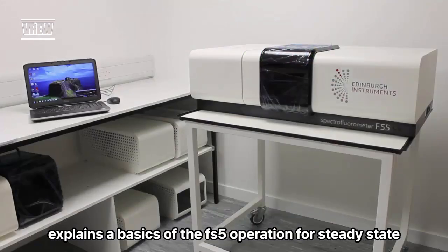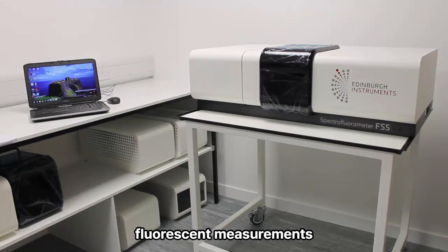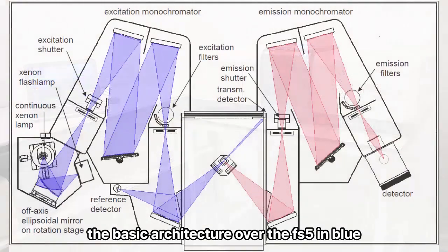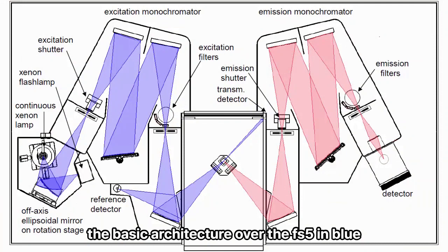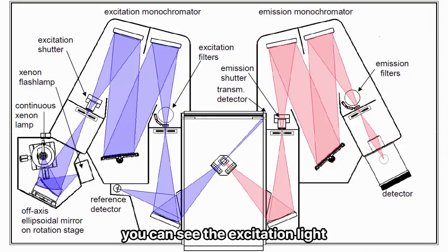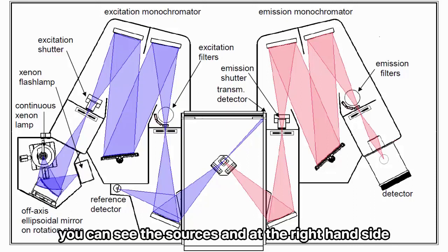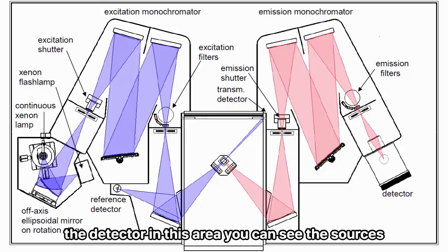This video tutorial explains the basics of the FS5 operation for steady-state fluorescent measurements. This diagram shows you the basic architecture of the FS5. In blue you can see the excitation light path, and in red the emission light path. At the left hand side you can see the sources, and at the right hand side the detector.